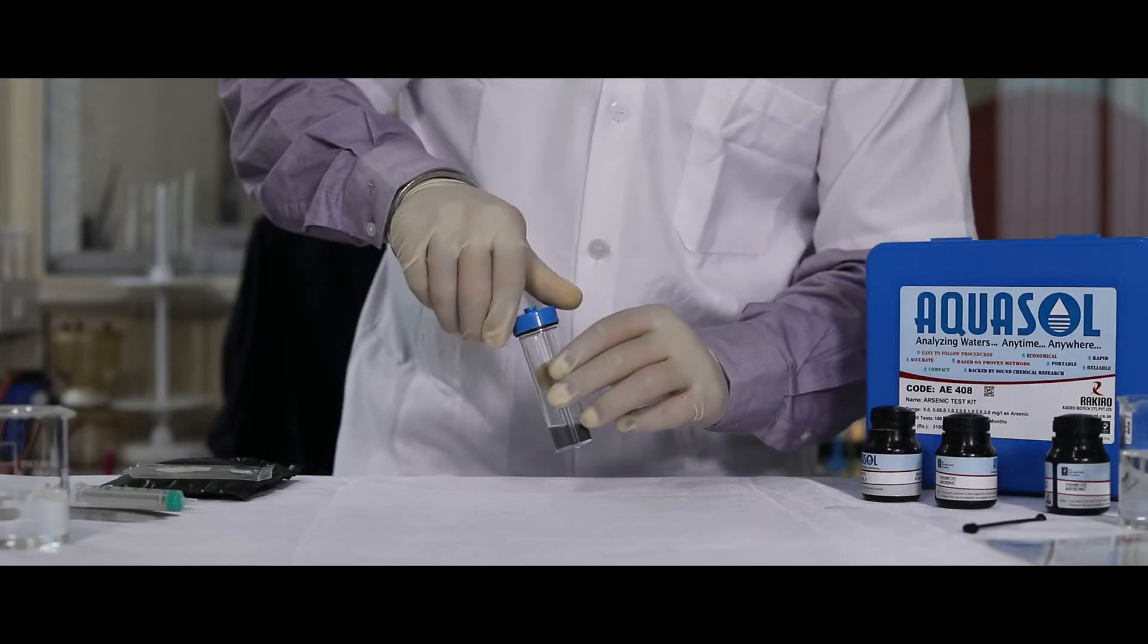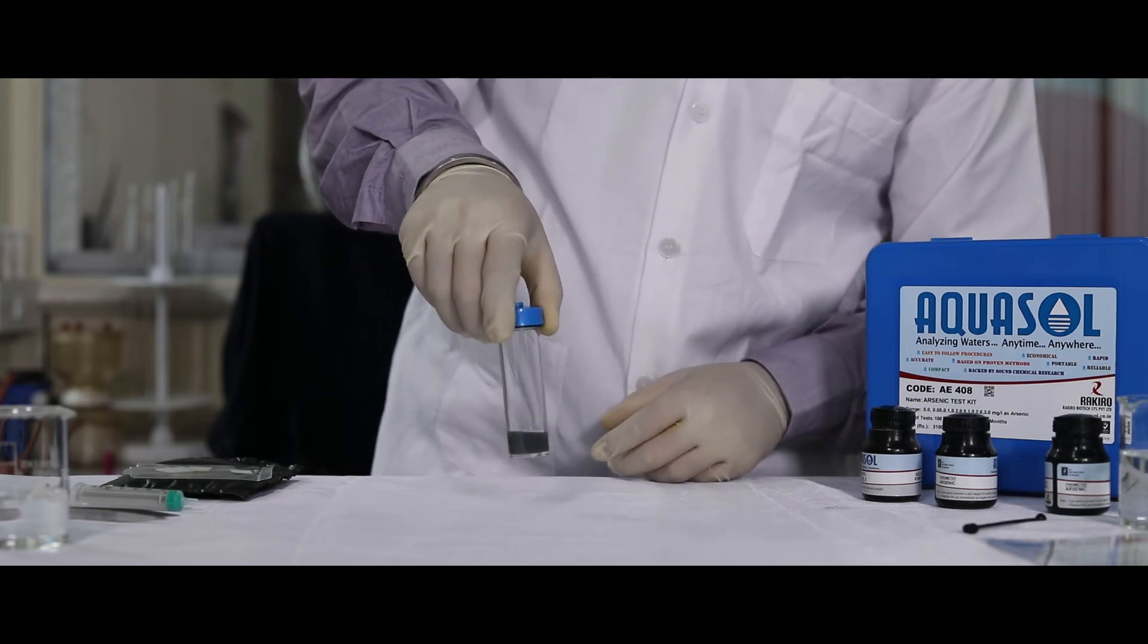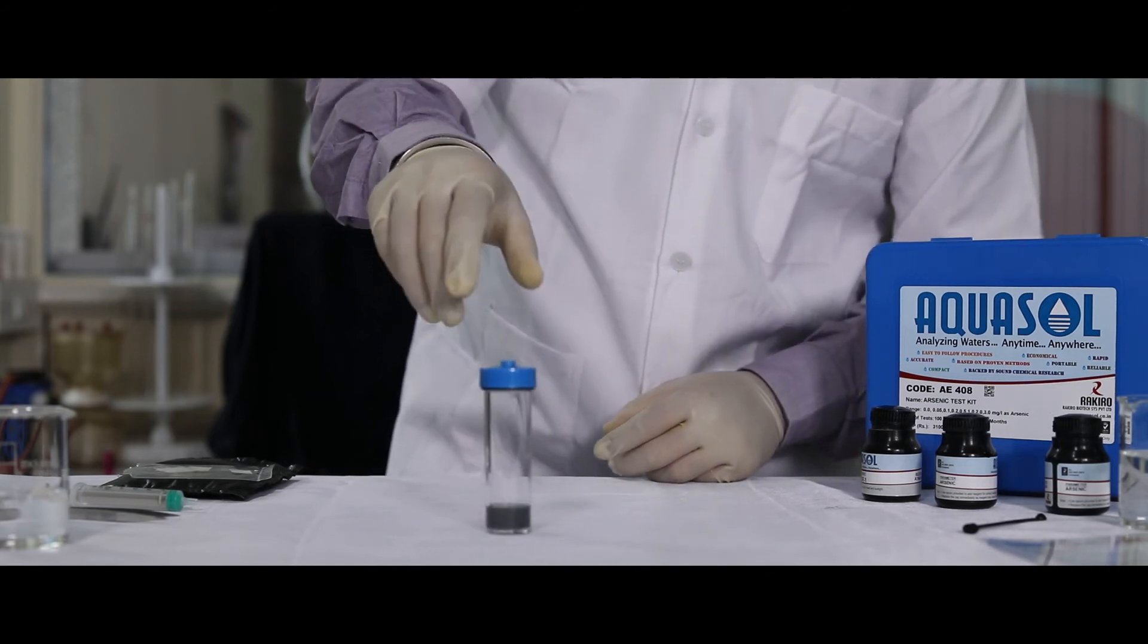Immediately screw the cap back and swirl the bottle gently to mix well. Allow the bottle to stand for 15 minutes.